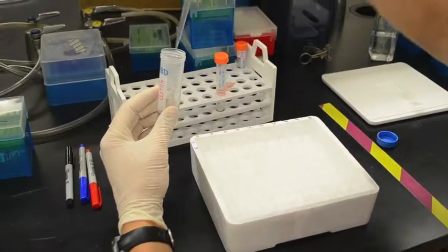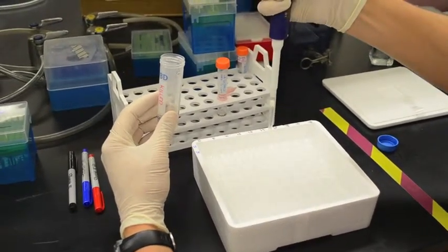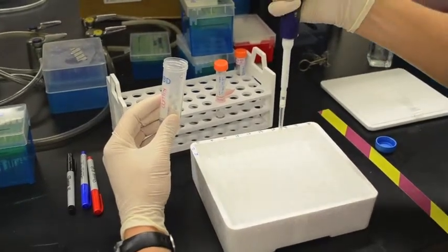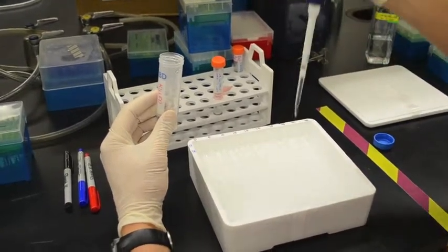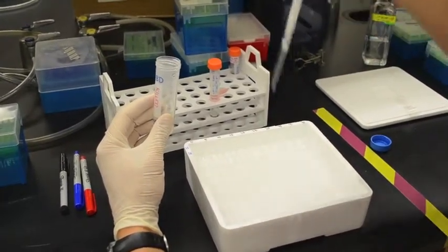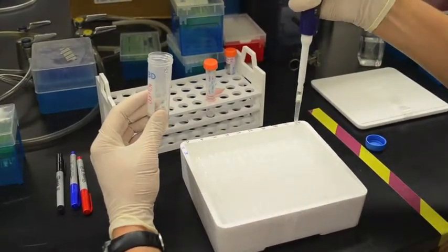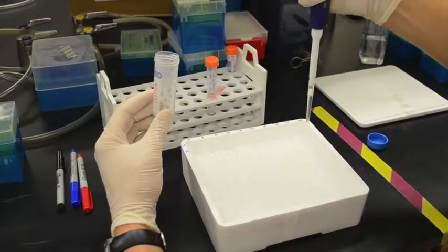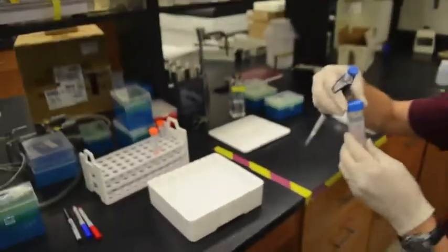A lot of times, I always count either in my head or even out loud to make sure that I am on the correct cuvette, because you really don't want to make any mistakes pipetting. It's very easy to do, and it will screw up your experiment, and you won't find out until you look at the data. So you want to be very careful with how you're pipetting. Make sure you pipette the right thing into the right place. It gets pretty complicated with this experiment.